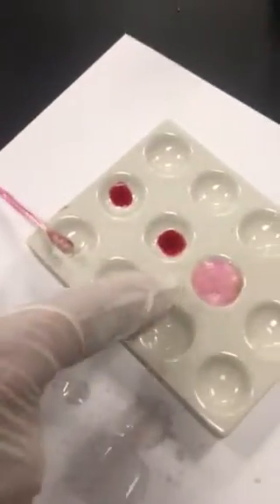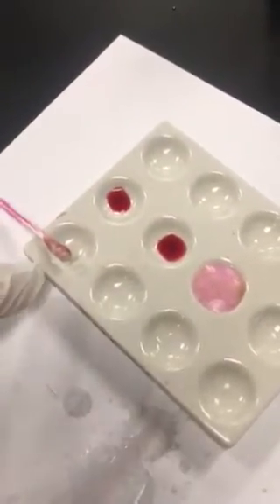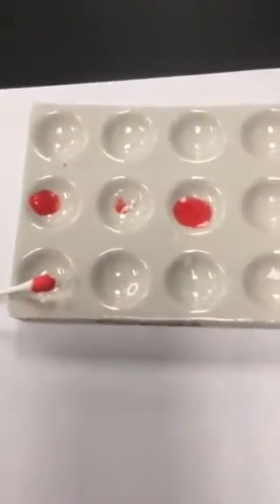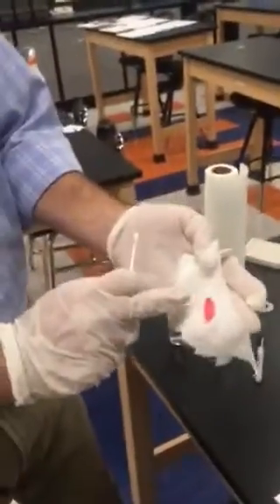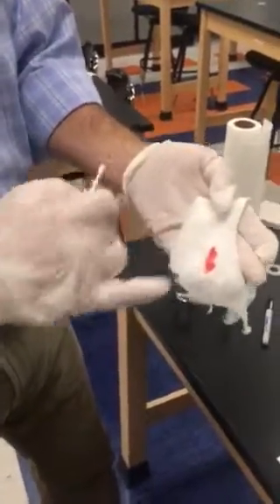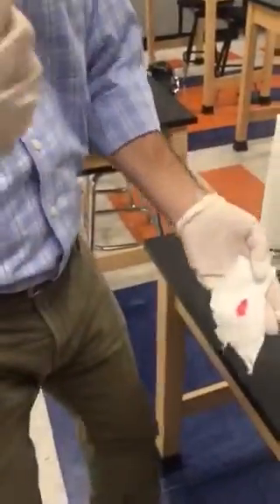If we had placed the Kastle-Meyer reagent, and if you zoom in here, we can see what happened when it was real blood. We have an obvious reaction to the Kastle-Meyer reagent when it's real blood. If we go over to where it's not blood, we see no such reaction. But back to this, once we have our Q-tip, we want to make sure we use distilled water and not put the Kastle-Meyer reagent directly on the shirt or on the blood stain. It will destroy the sample, and we can do no further testing.